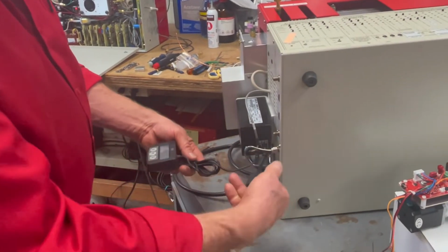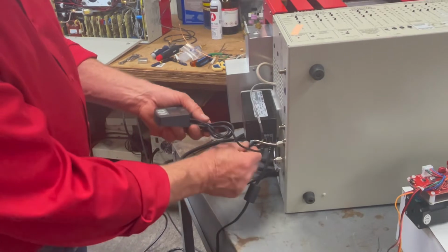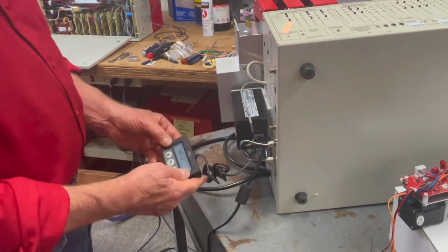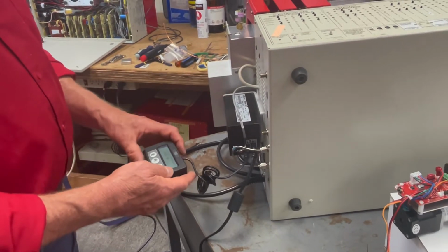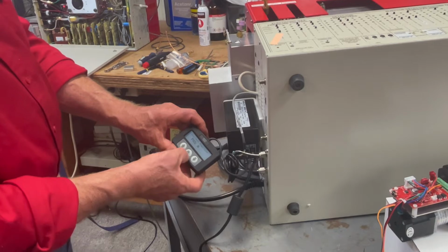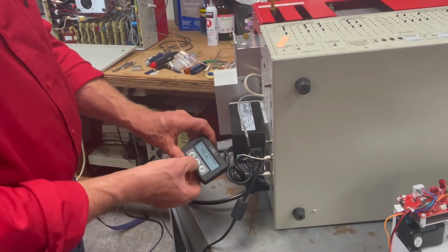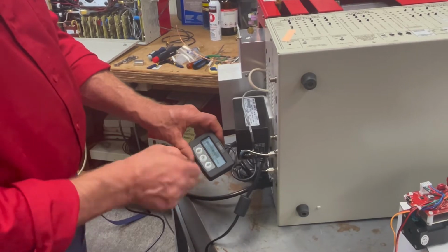So there's power plugged into the bottom of the valve, and then there's the brain box, and then there's the control wire from the GC, because really the GC controls the valve, but sometimes you want to do that manually, and sometimes if it loses its digital memory, you have to let it learn where the stops are too. And the way you do that is, this is the brain box, and it's got an up position, so it's going to position B, and then it's down to position A, and then it's got this home button. You hold that down for a few seconds, and then it comes up with a menu.